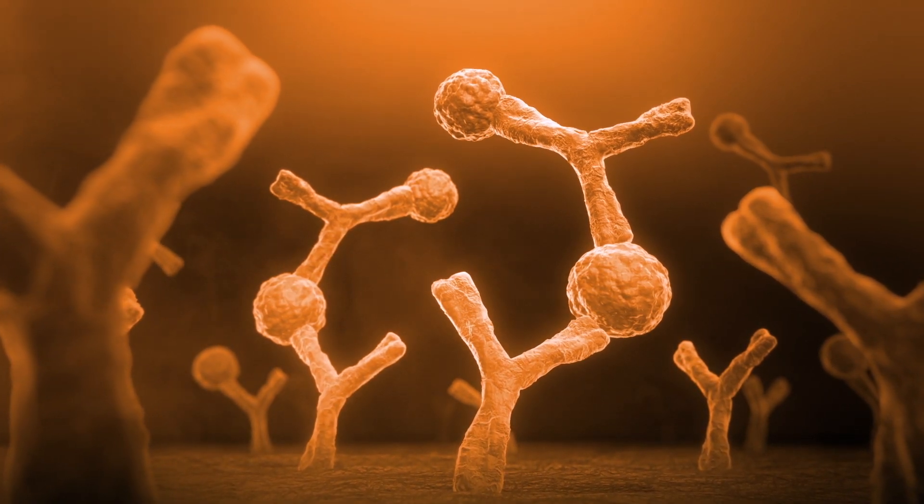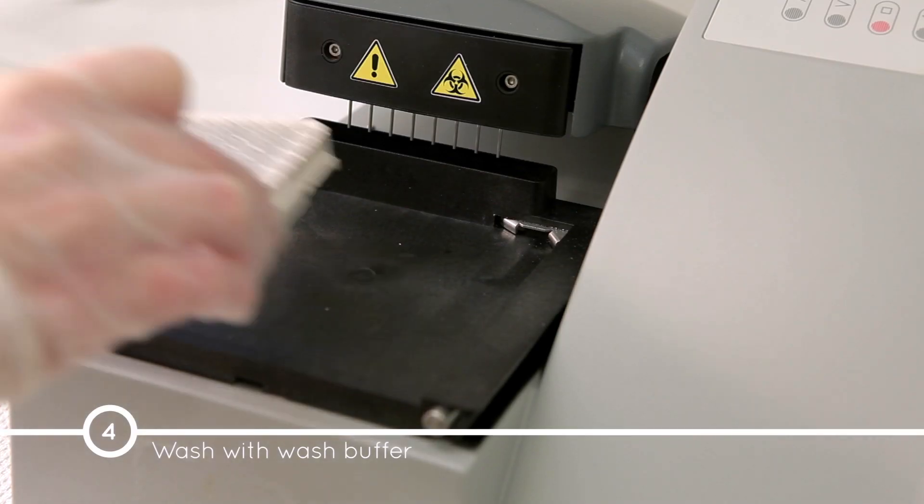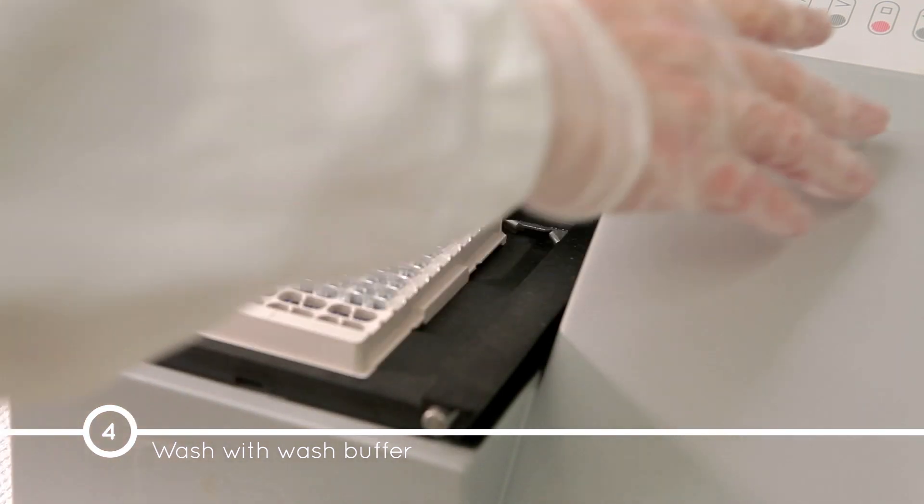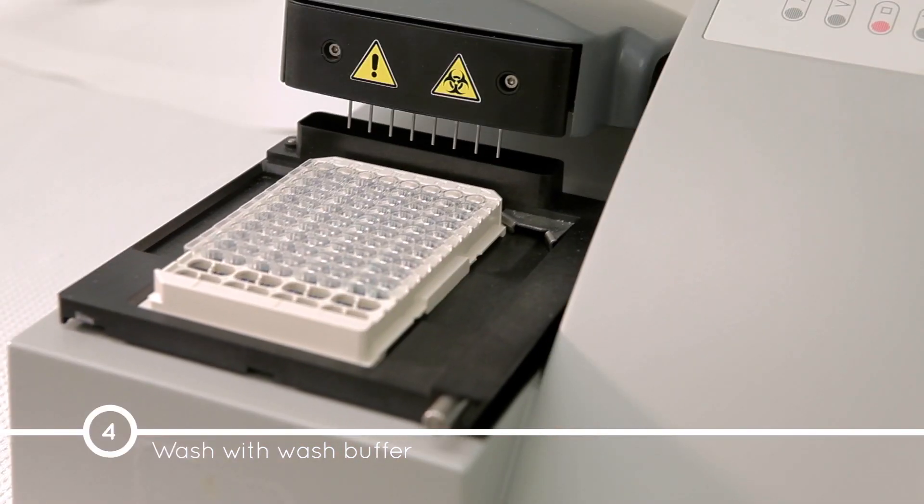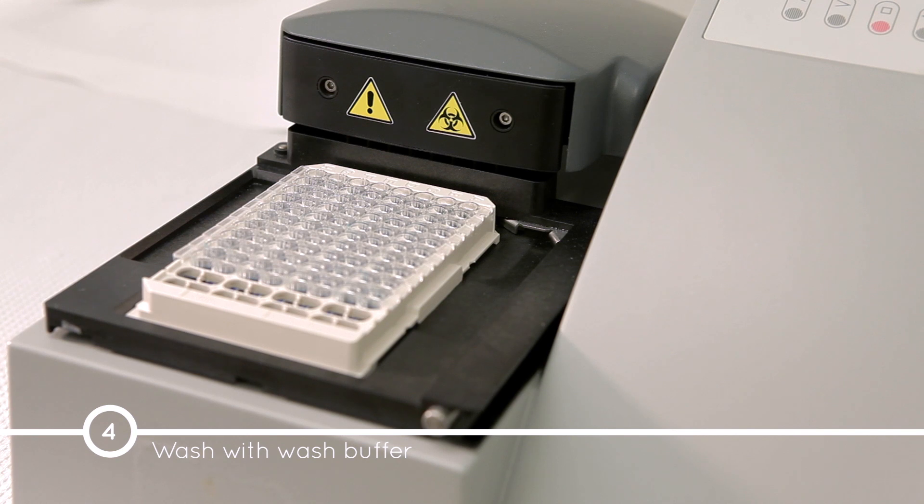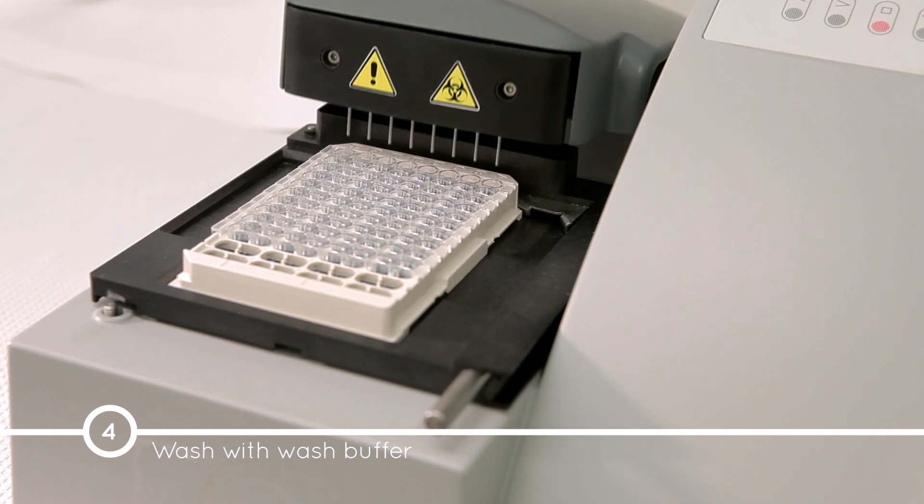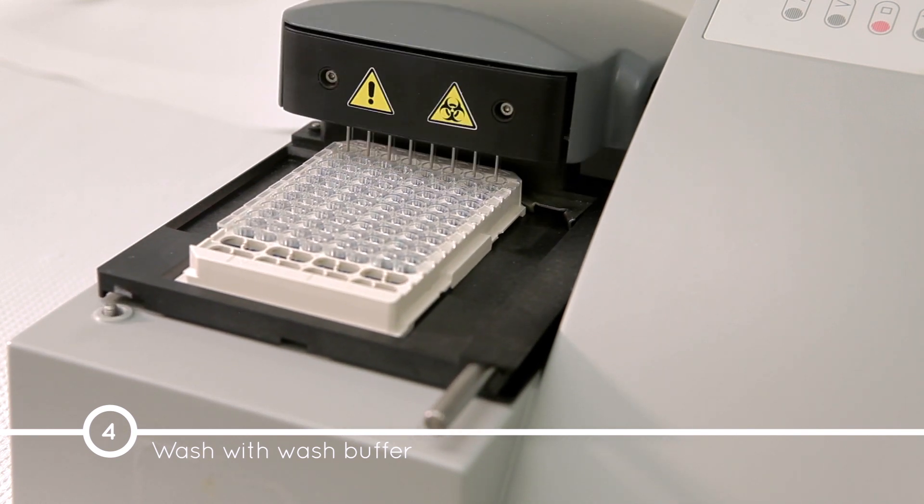After the 60-minute incubation, wash the plate six times with 700 microliters of wash buffer per well, using an automated plate washer with overflow function. Do not include a soaking step in the wash program.